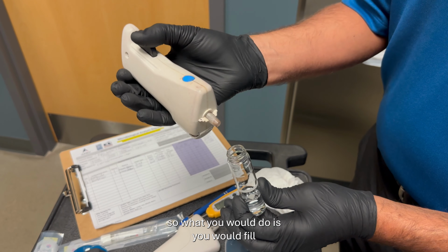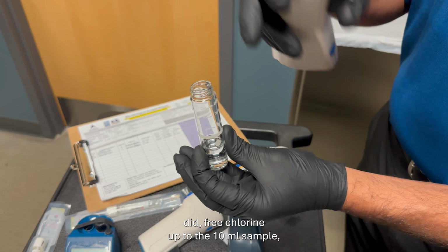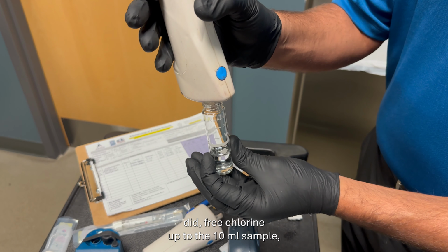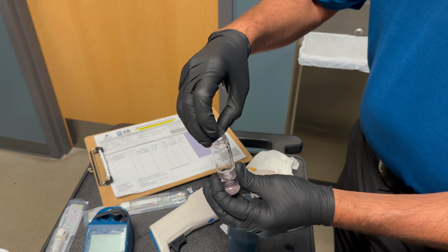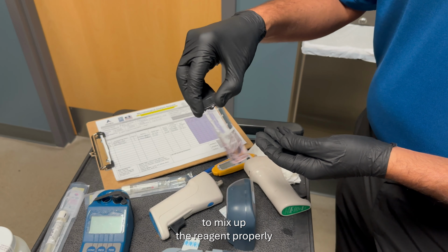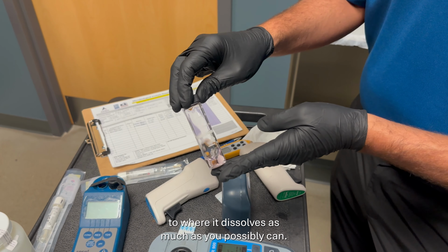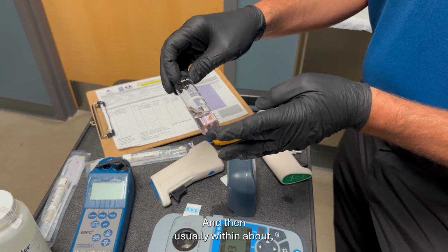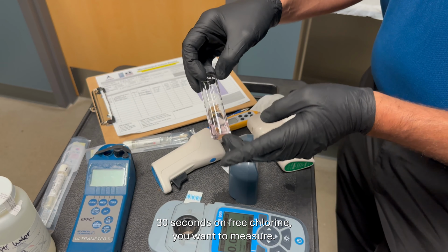So you fill the line up just like you did for free chlorine, up to the 10 mil sample, and then you dump in the proper reagent. You swish it around to mix up the reagent so it dissolves as much as you possibly can. And then usually within about 30 seconds on free chlorine you want to measure.